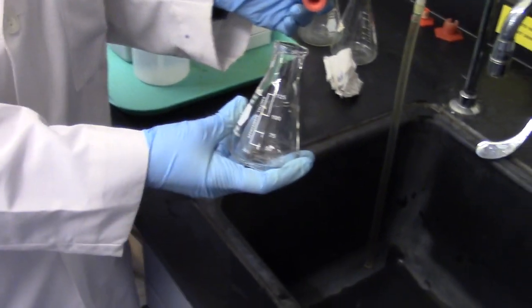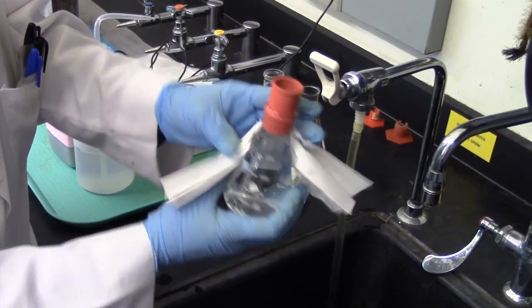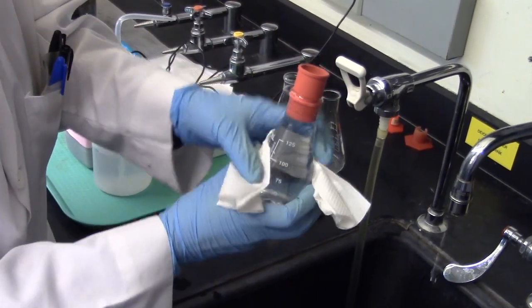Now fill the flask with water. Make sure to dry the outside of the flask with the paper towel.